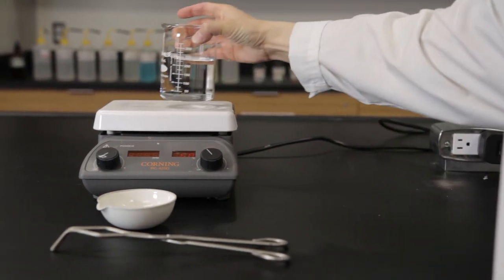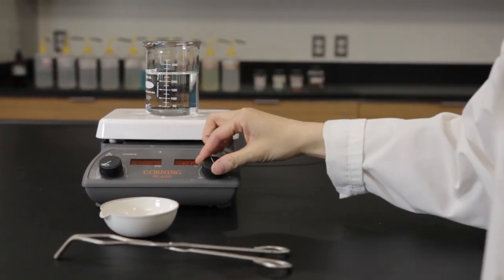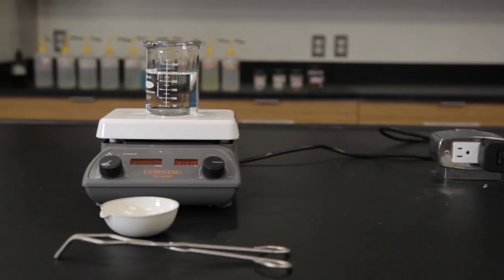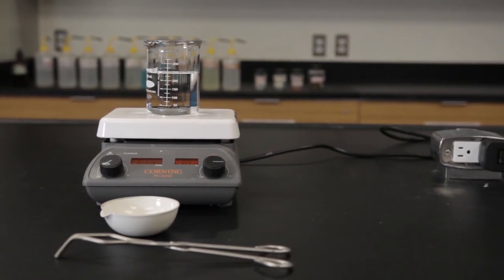In the meantime, on the same hot plate, heat a 400 milliliter beaker filled with approximately 250 milliliters hot tap water. This will serve as the hot bath.